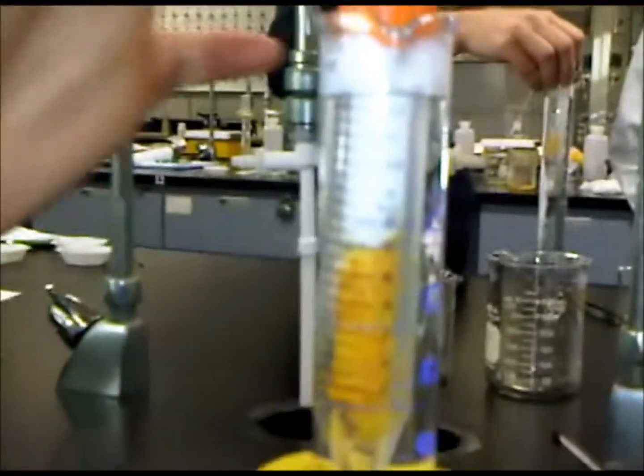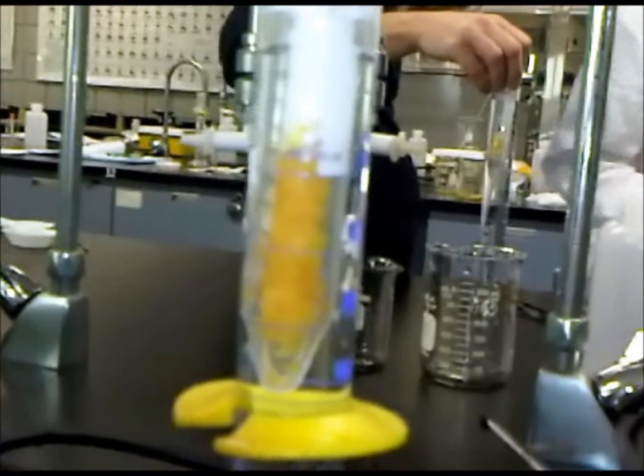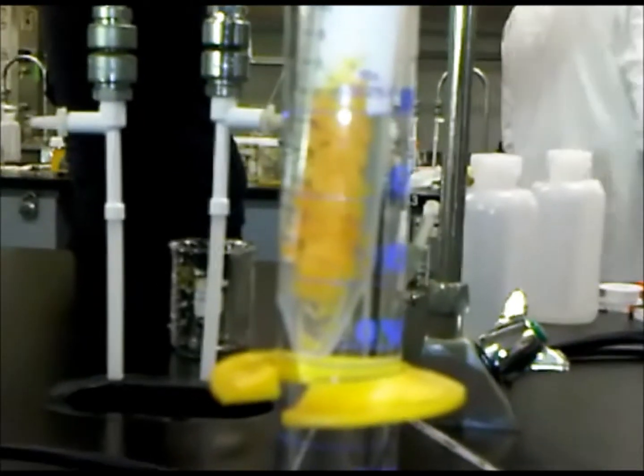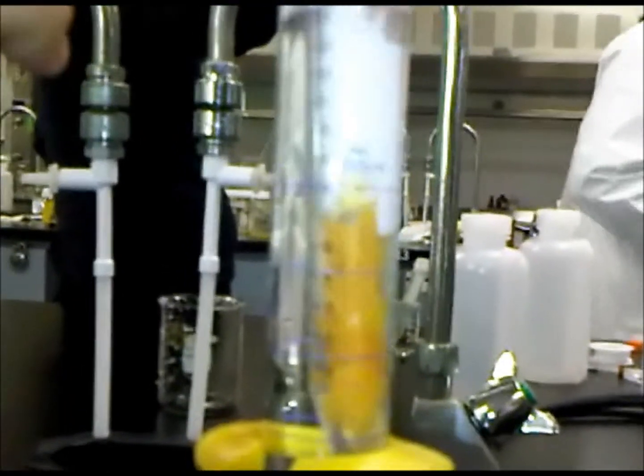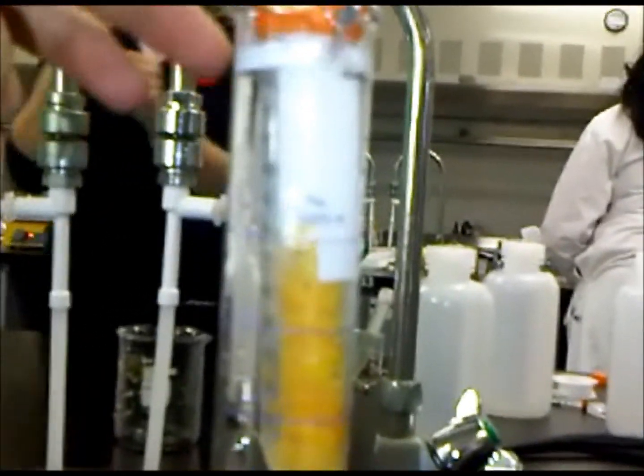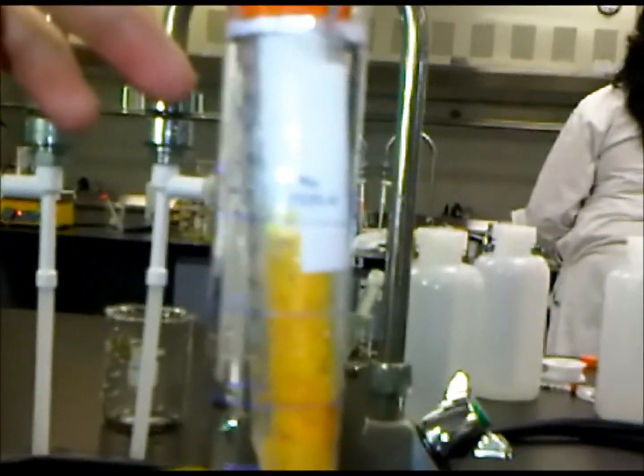I hope it works. Hopefully it works. That would be awkward if it doesn't work. Okay, put the ice in. Come on, work. Just a little bit. Move it up. Come on.